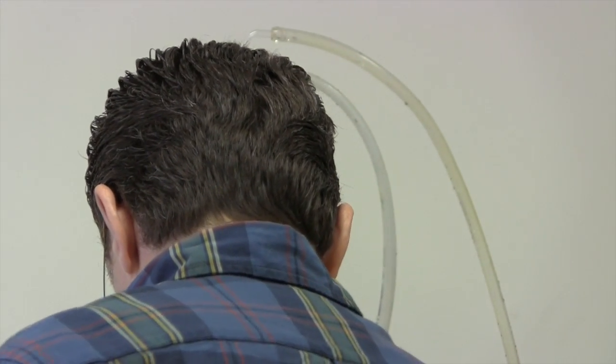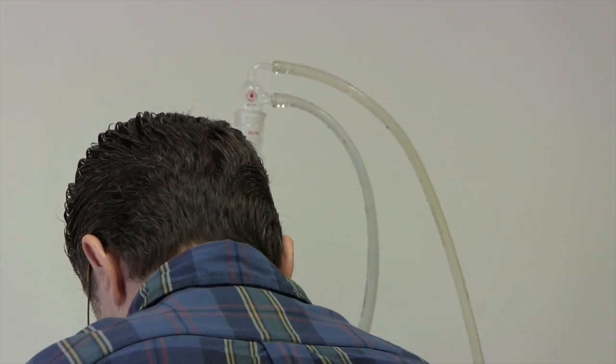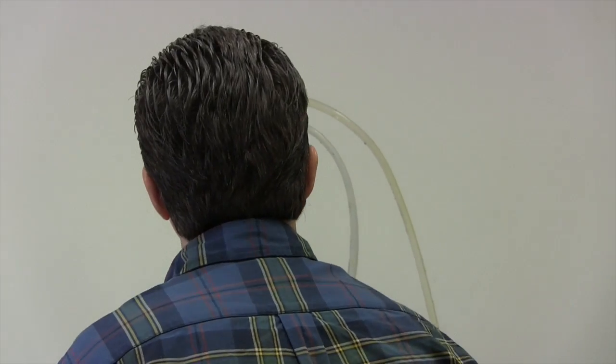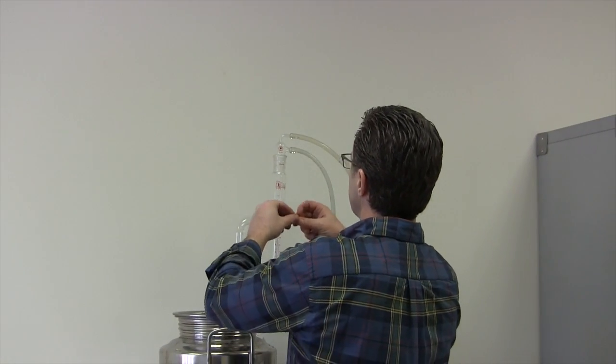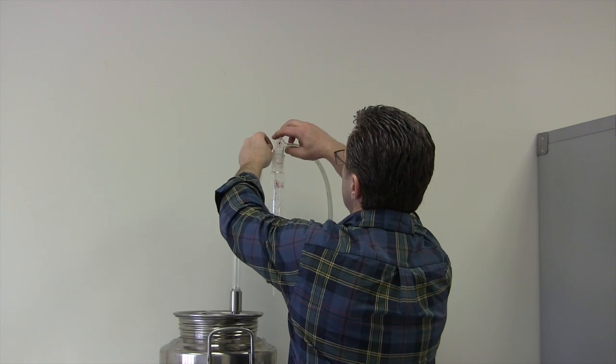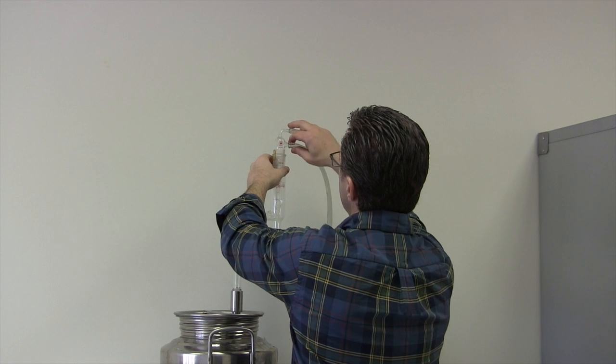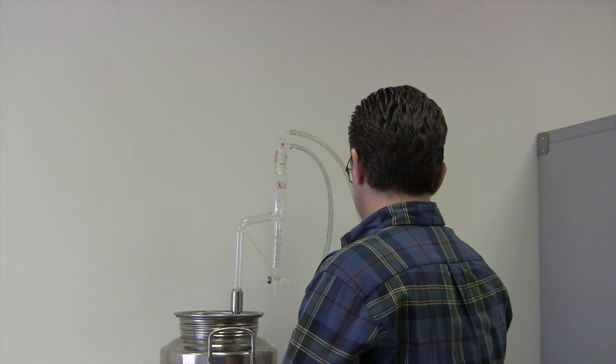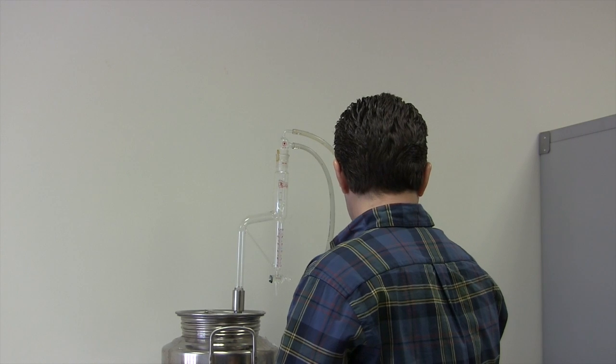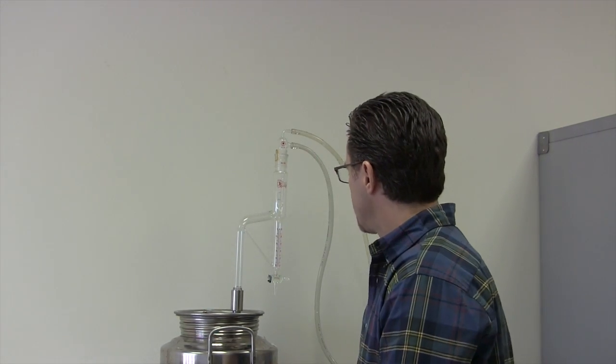Now, I usually have to vent the condenser, because we don't want it to seal all the way. That would be bad to have a closed system. So I vented it a little bit, and basically that's all you have to do for the setup. Now we're ready to start.